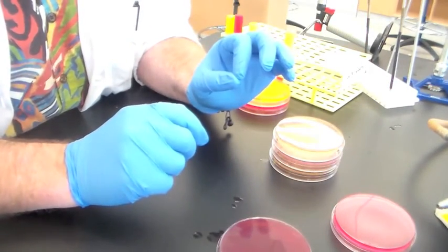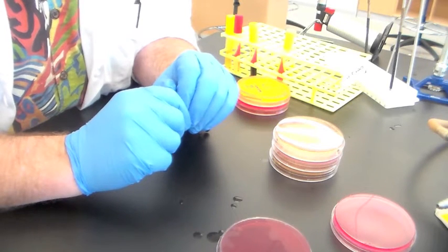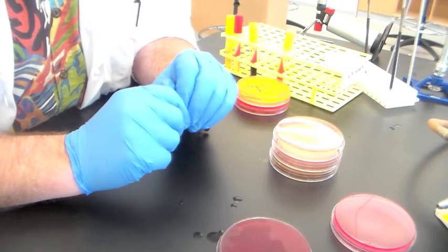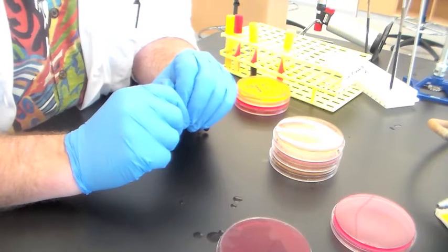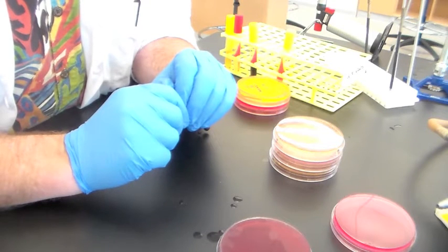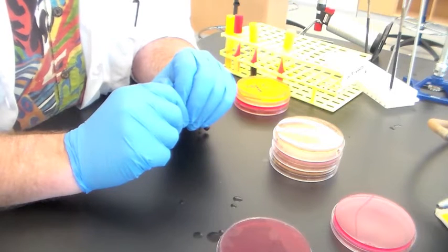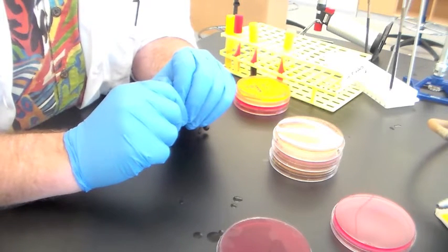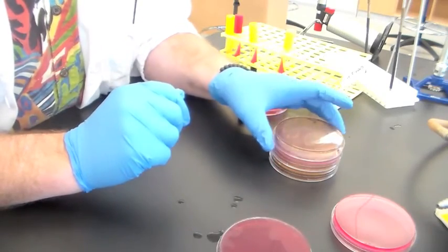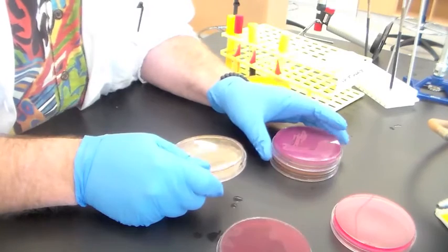MacConkey agar is selective. It only allows, for the most part, gram-negatives to grow. Gram-positives are inhibited, for the most part, by bile salts. There are bile salts added to this media at a concentration which makes it difficult for gram-positives to grow, but gram-negatives will grow just fine. There is also a pH indicator in here which will allow you to differentiate based on the ability to ferment lactose.